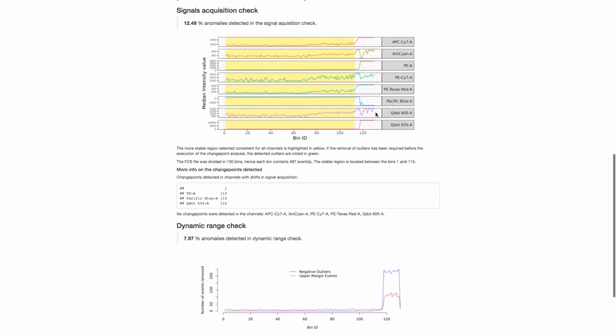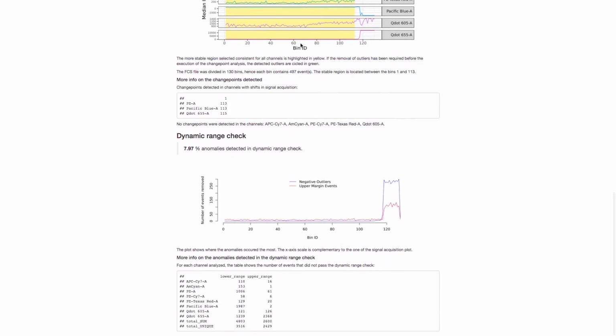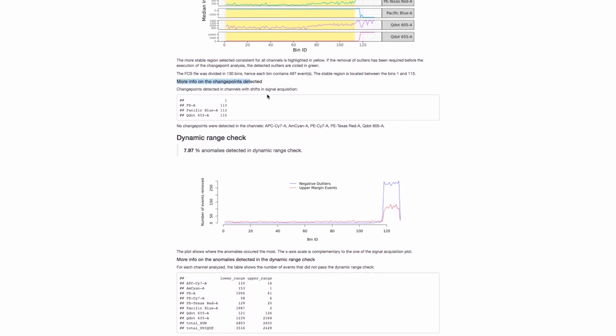The next method to turn our attention to is the signal acquisition check. What you'll see here always in the results is a single contiguous region of the data, and it could be at one end or the other end, or it could be in between. This is based on the settings for this actual analysis method. The yellow region is what highlights the region that is considered high quality, and it will end up matching across all channels. Depending on your settings, this could be a much smaller region or it could be larger, it just depends. We also have basic information here about the change points that were detected.